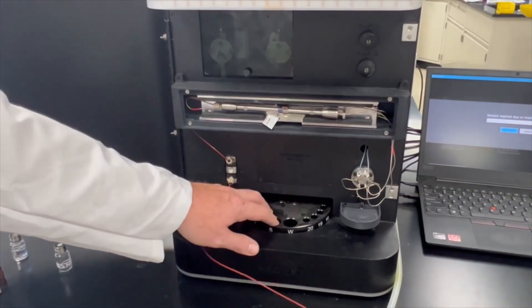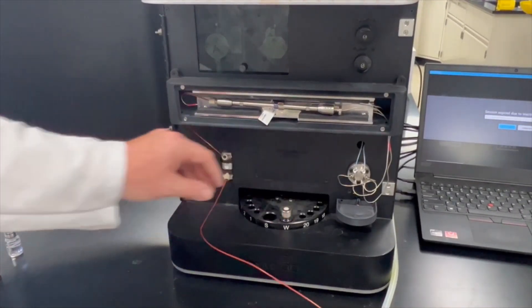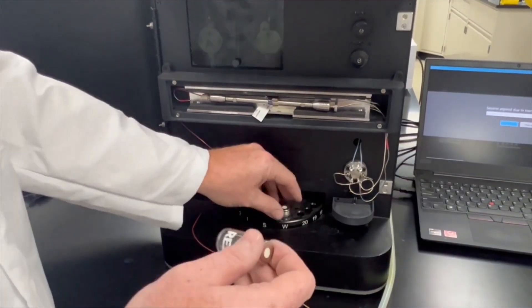Now we're going to load up our solvent and waste. So we're going to put our solvent in.